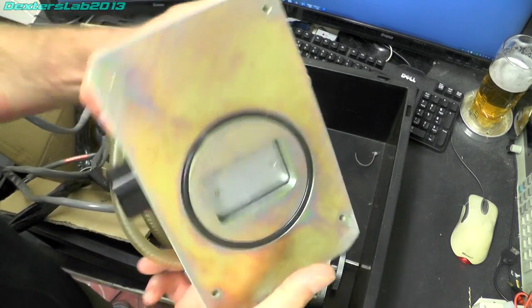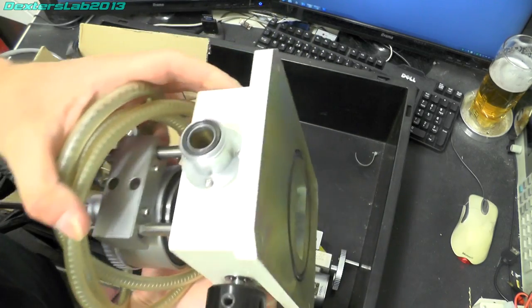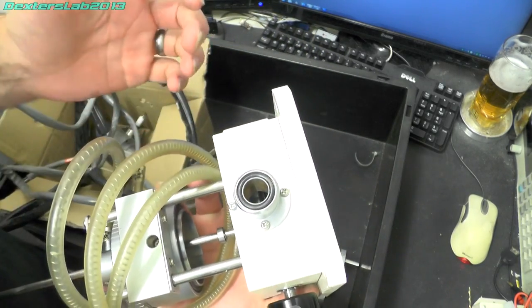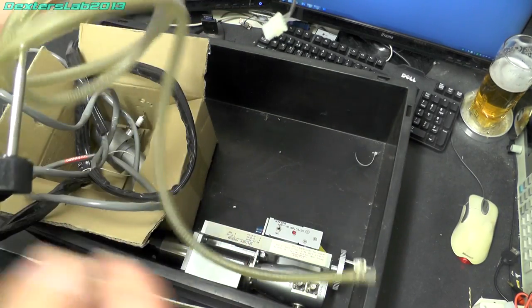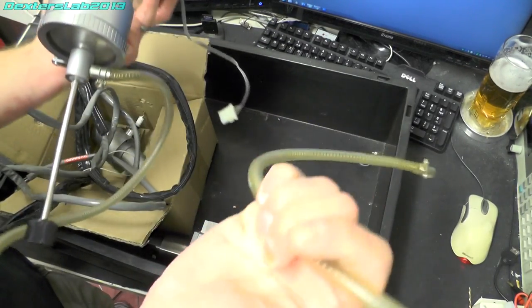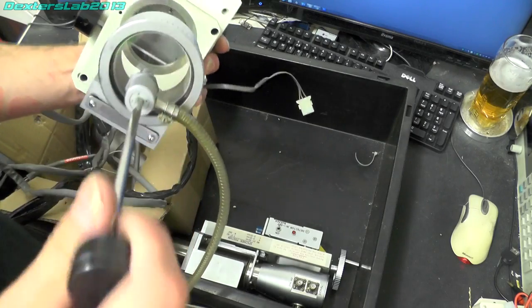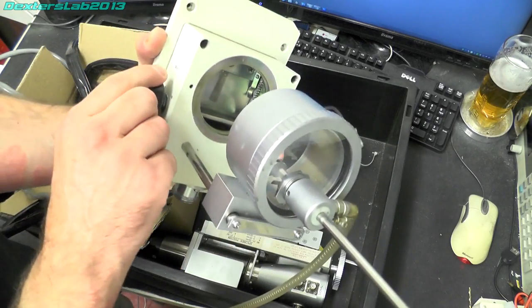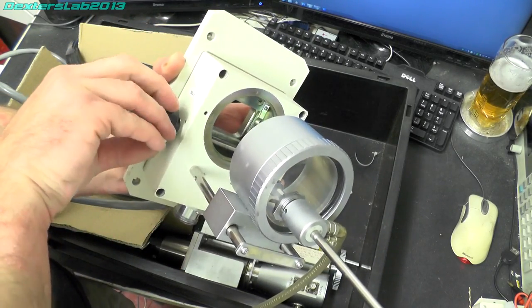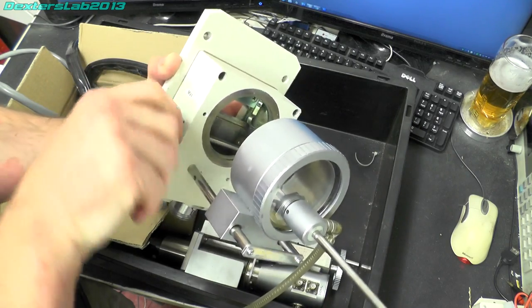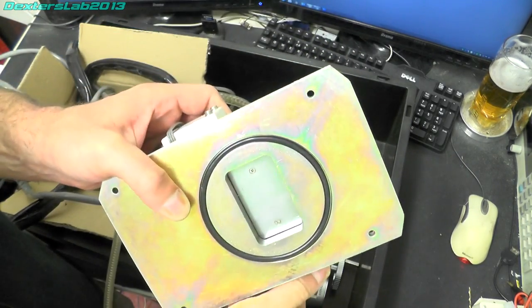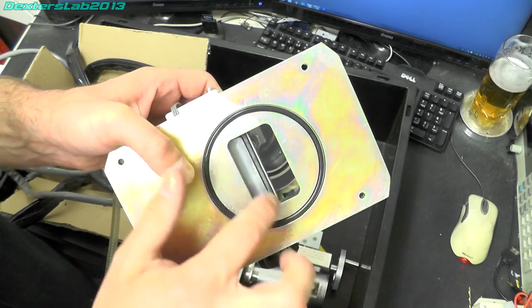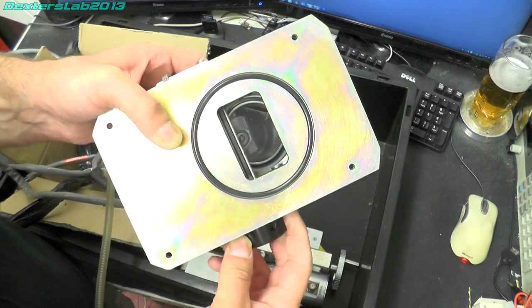And here we have that airlock arrangement so we've got the vacuum port on the base. I'm not entirely sure what this pipe is for. So inside there we have an airlock arrangement, large rubber gasket on there.